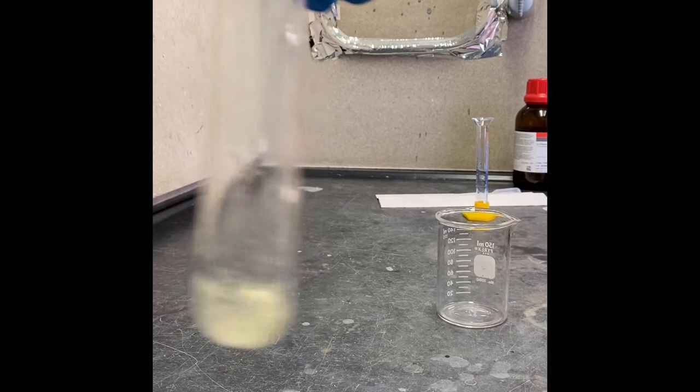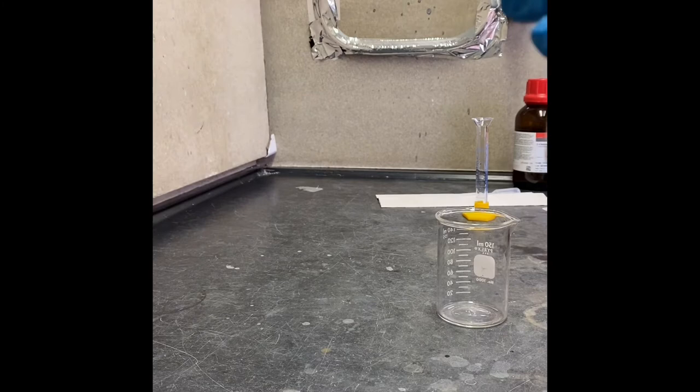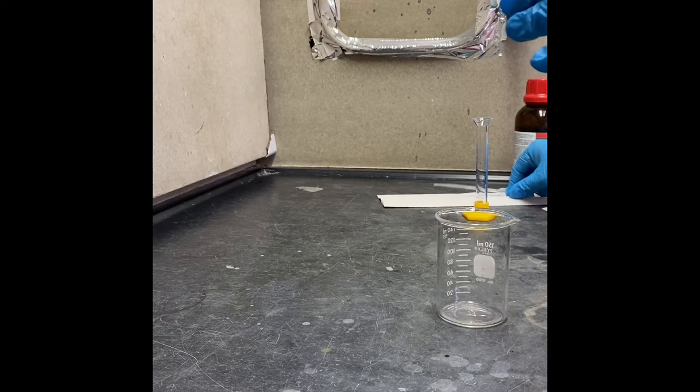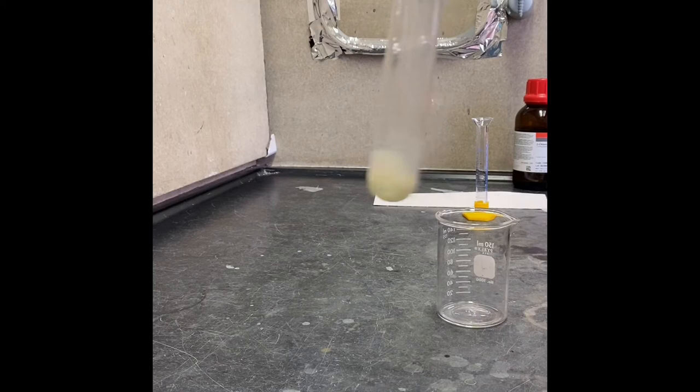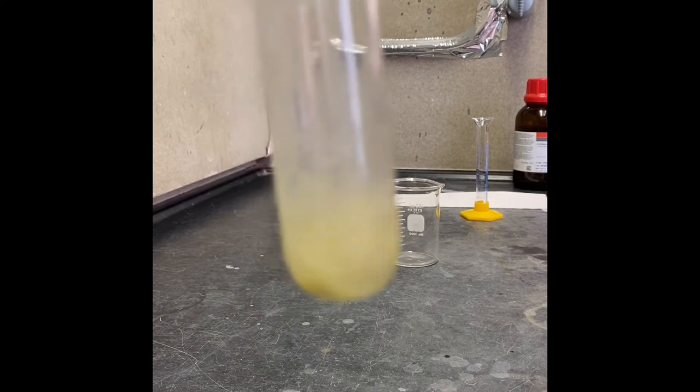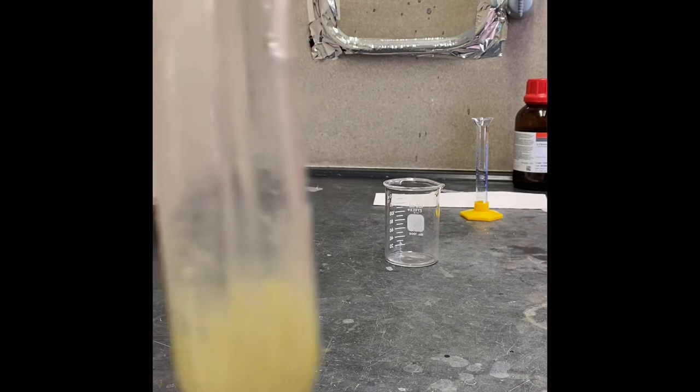I will crush that with a stirring rod. Let's stir that up with the stirring rod for at least 30 minutes to see if the reaction is done. It's getting warm right now. The color changed to yellow. After five minutes, that's the color we have.